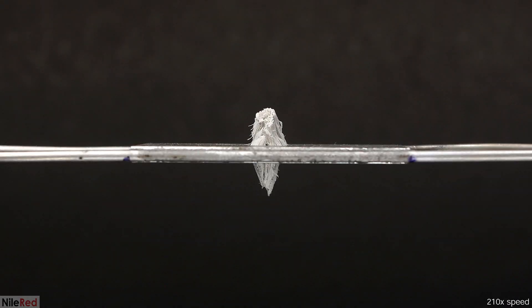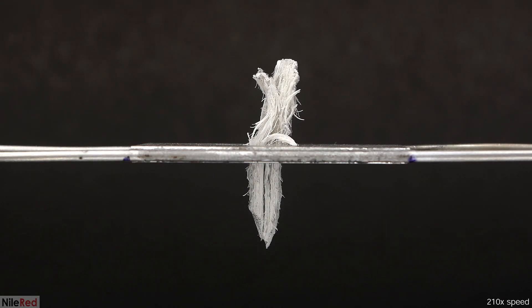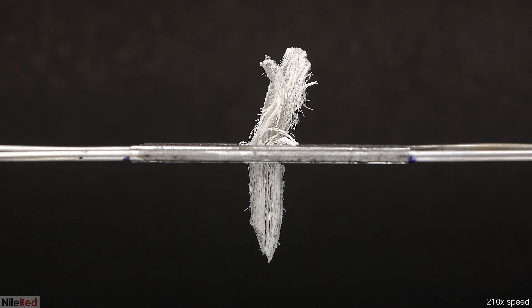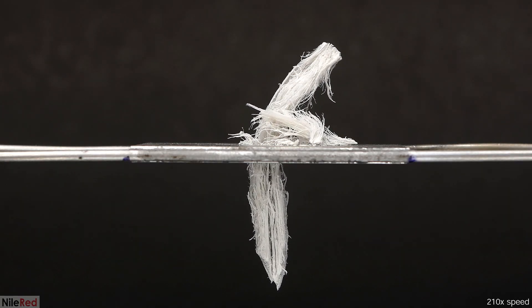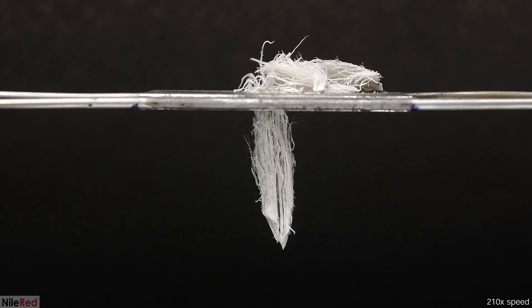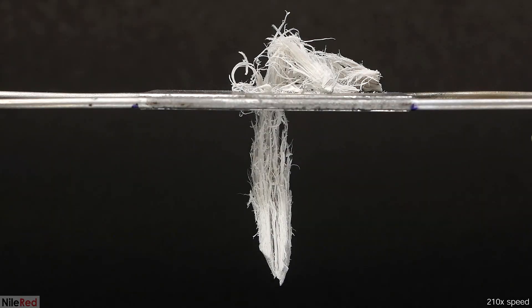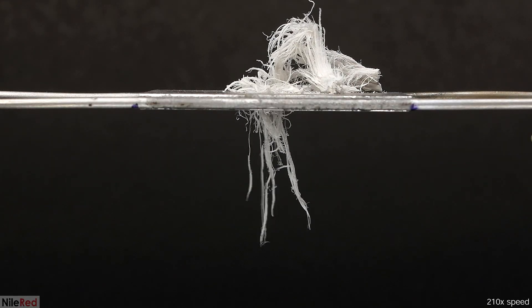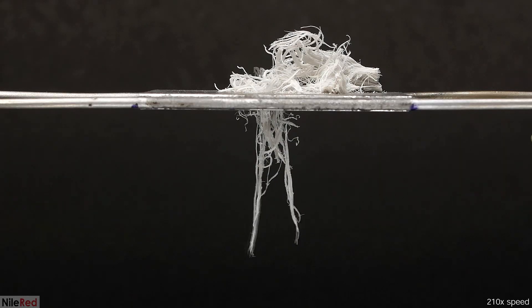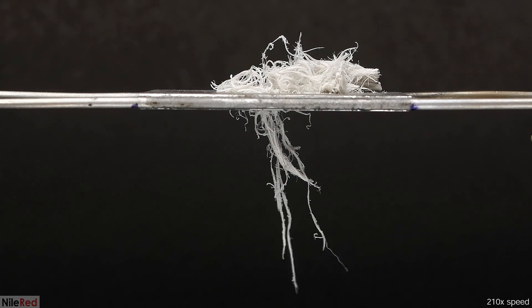So because this works so well, I decided to try it one last time. The stuff growing in this run wasn't nearly as wide as before, and honestly I didn't think it was as cool either. However, what it did show me was that the thickening of the tower is probably not because of the technique that I'm using, and it's most likely just because I knocked things. There was one similarity with the other run though, where the tower on the top died relatively quickly. I'm not sure if this is specifically caused by anything though, or if it was just coincidence.